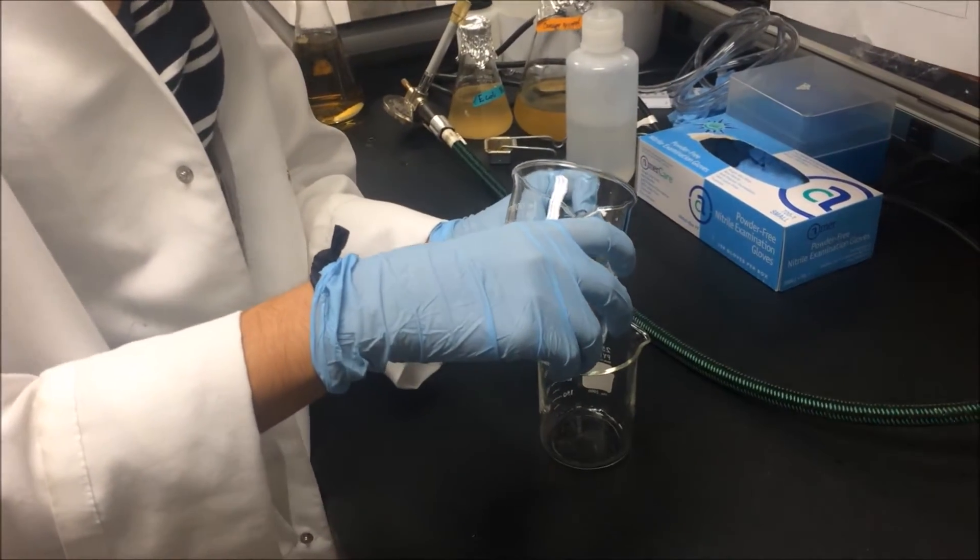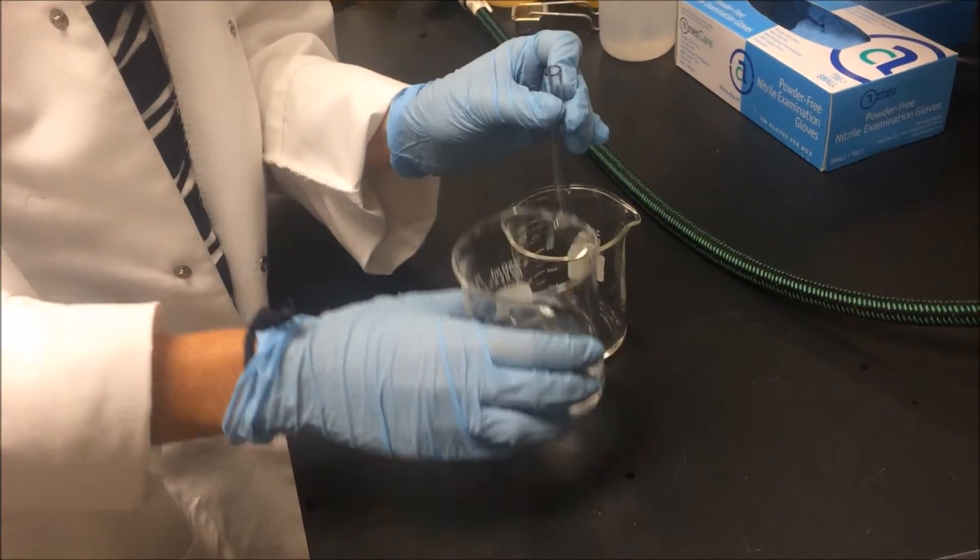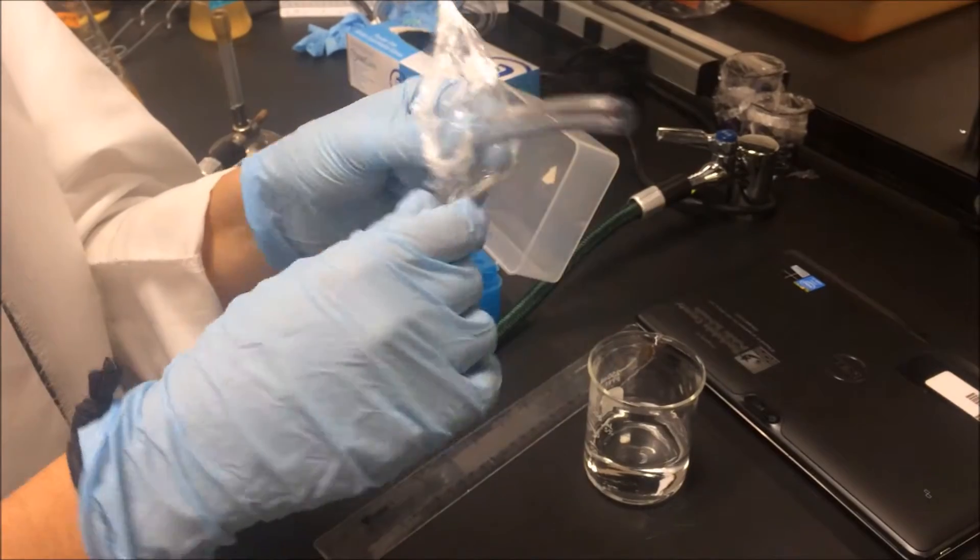Pour 50 milliliters of water through the tube. Place plastic wrap on one end.